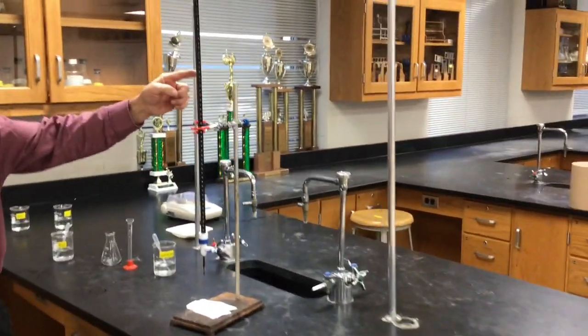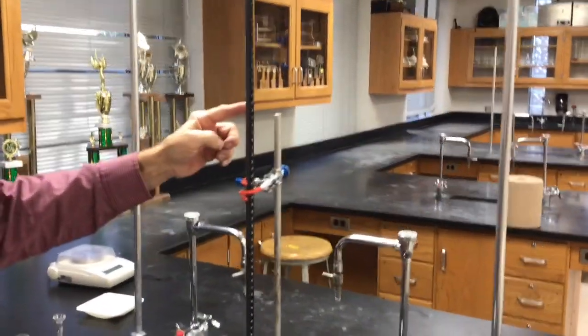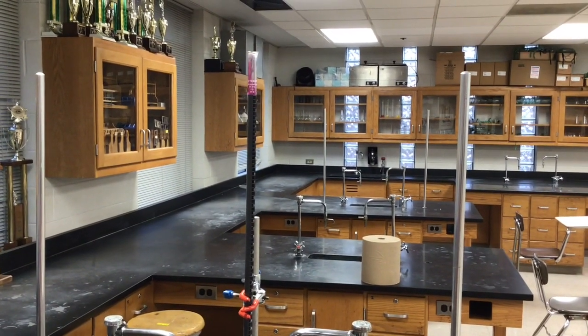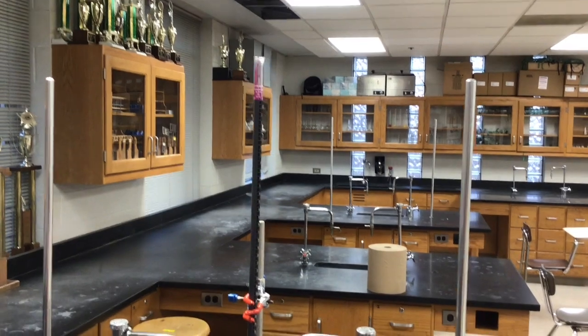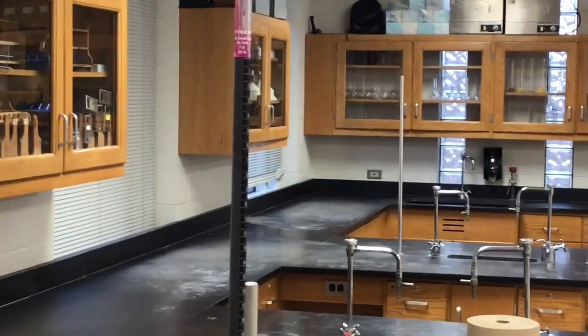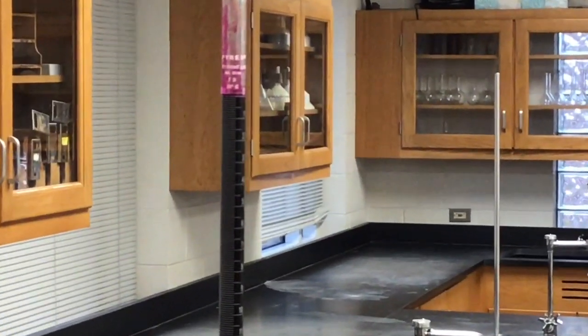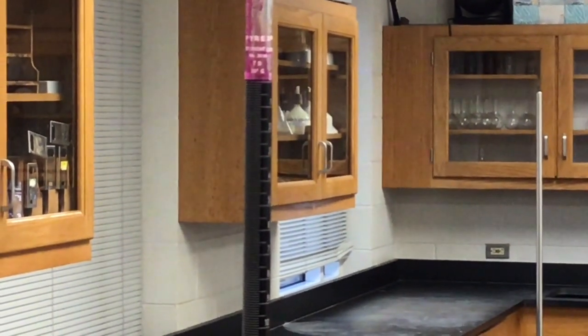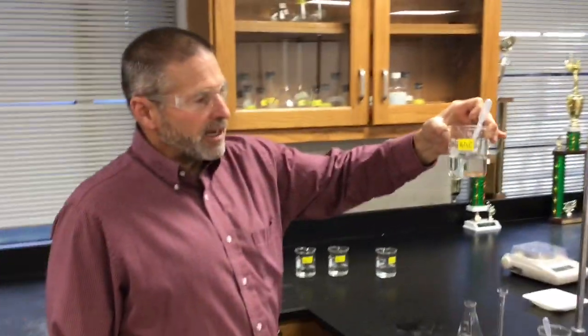We're at our lab station. We are, and so now we're ready to titrate. Again, we have our permanganate solution in the burette. It's got a beautiful purple color. Wow, what a nice color that is. It's a great color. And remember, we know its concentration. It's 0.150. So we'll use our known permanganate solution to titrate our unknown hydrogen peroxide solution.